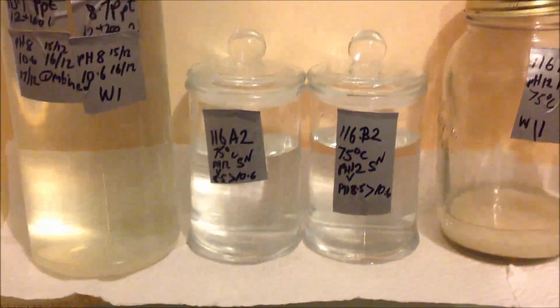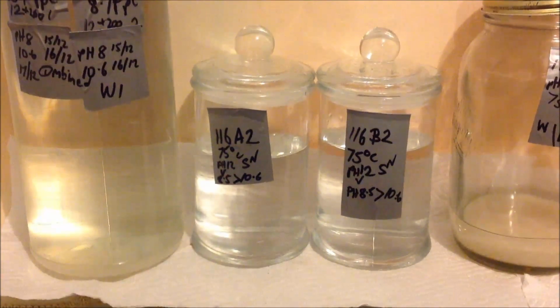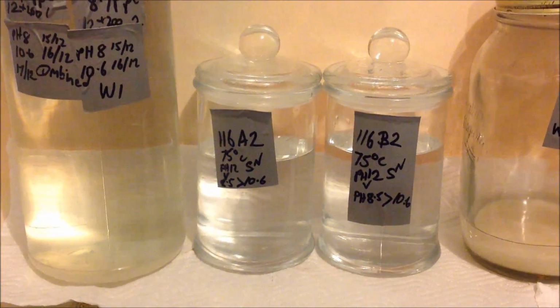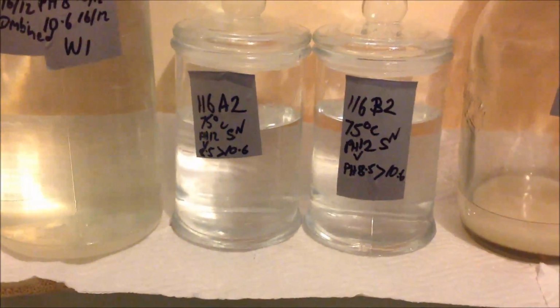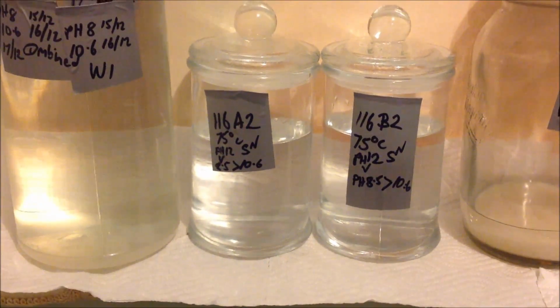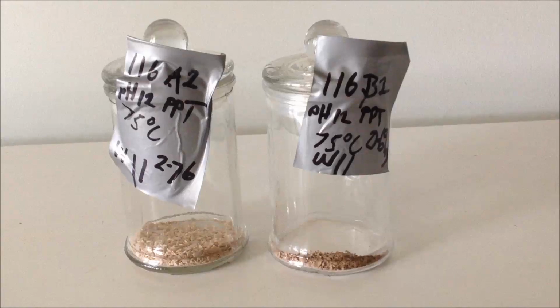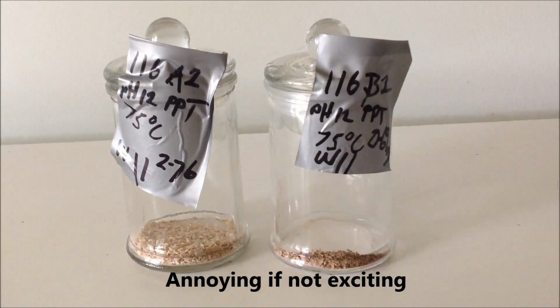The solution that was taken off that precipitate after it was boiled, or not so much boiled, but taken to 75 degrees C, was attempted to re-precipitate out of that, and we got nothing. So this middle line of inquiry shall just disappear from now. There was no more so-called M state in that sample, so that's it. Guys, this is really annoying if it's not exciting.